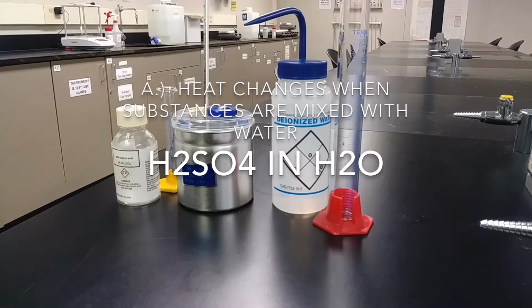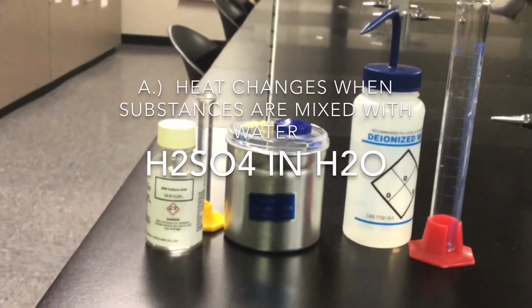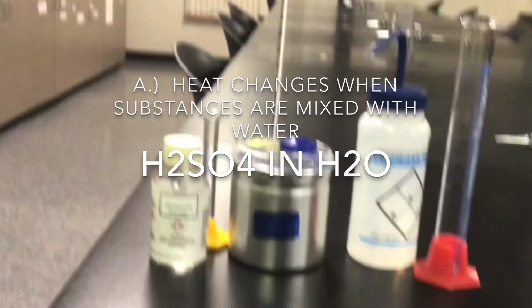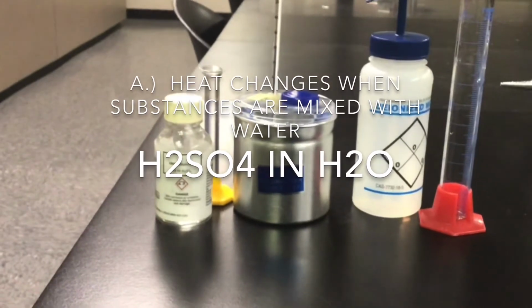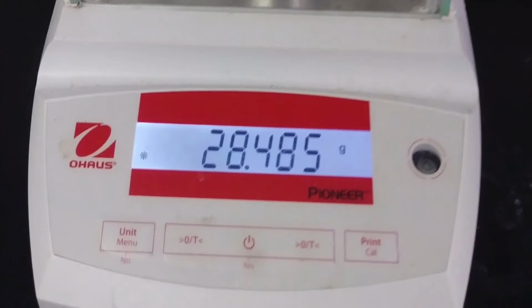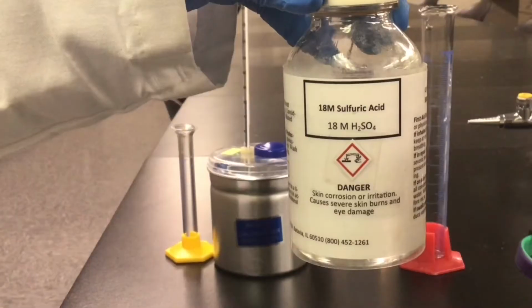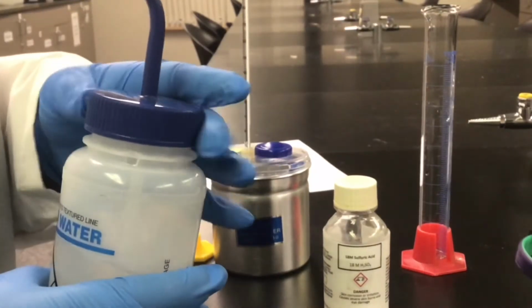Next, we will conduct part A2, sulfuric acid in water. Again, starting with the mass of our calorimeter, please pause the video and record the mass of your calorimeter. For this experiment, we will use 18 molar sulfuric acid and water.